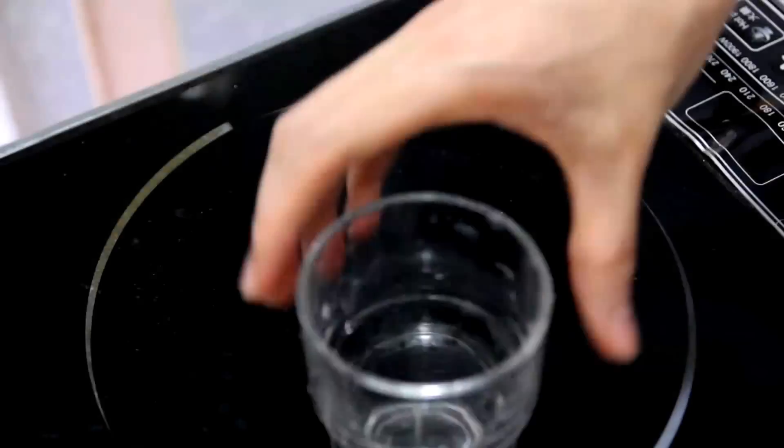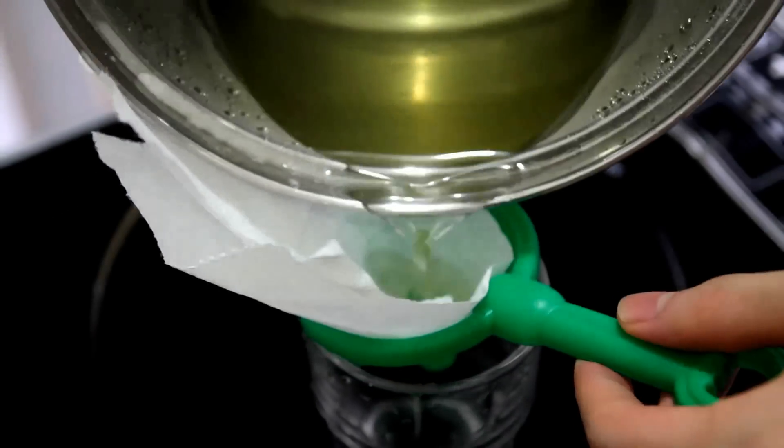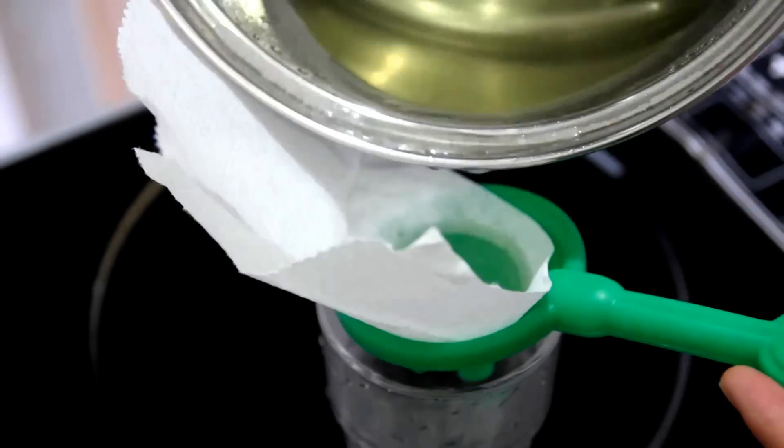Once it's done, filter the solution using filter paper or multifold towel paper to filter out dust and undissolved alum.